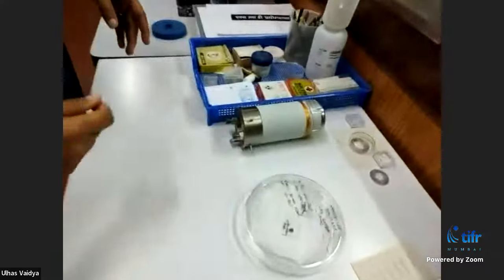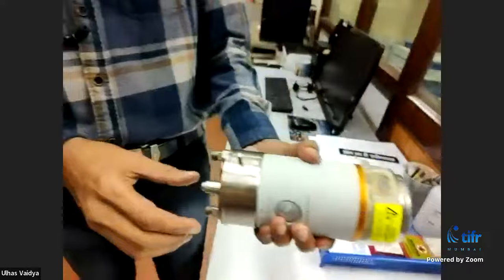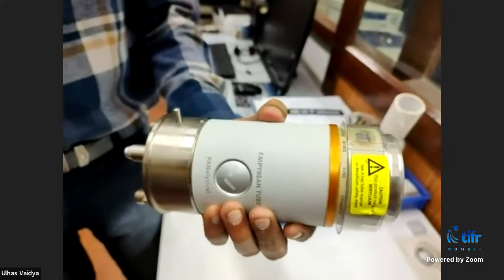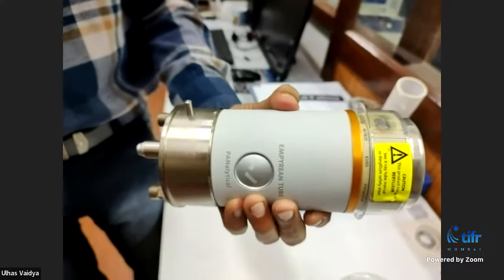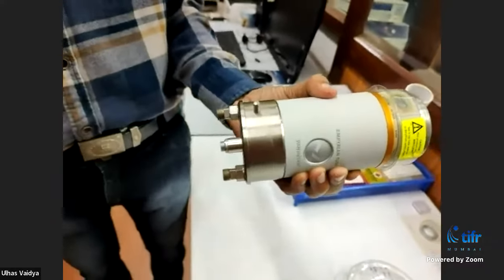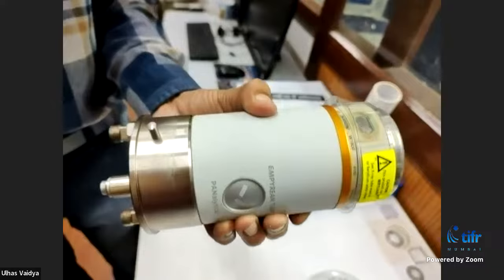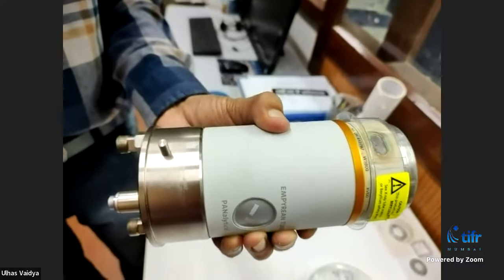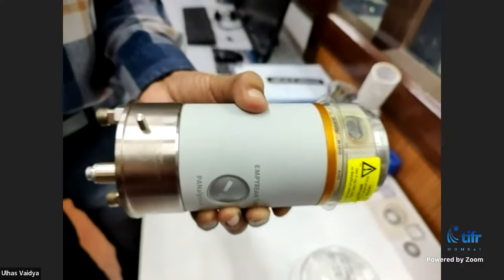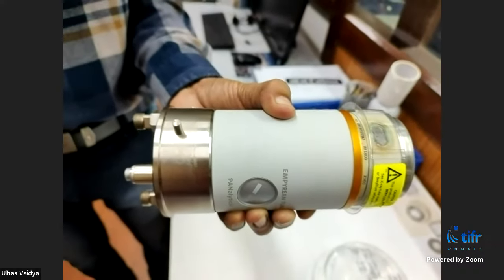The wattage of the tube is something like 2 kilowatts. It is not very big like a medical X-ray which has more power, but this is used for X-ray diffraction purposes in the laboratory.